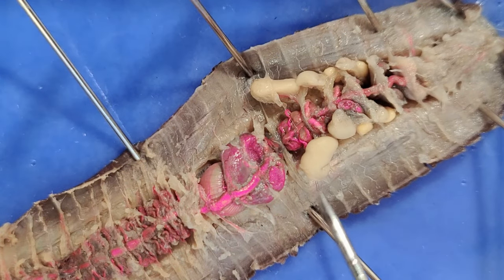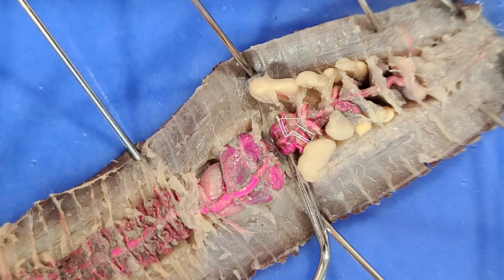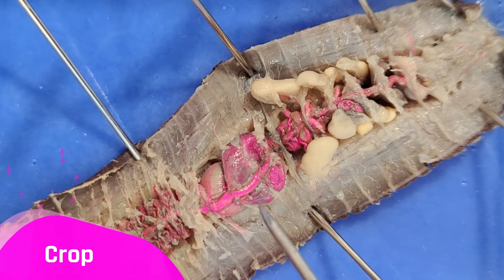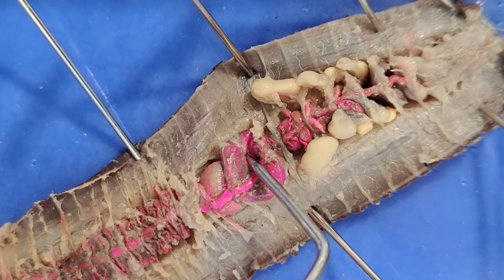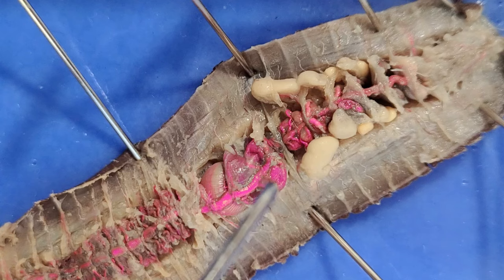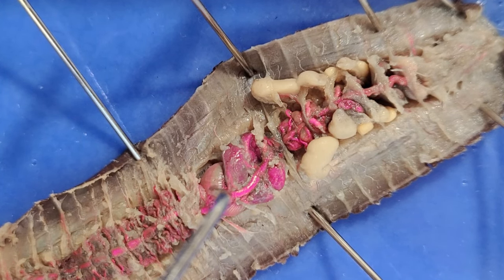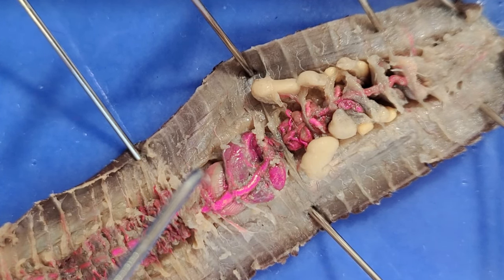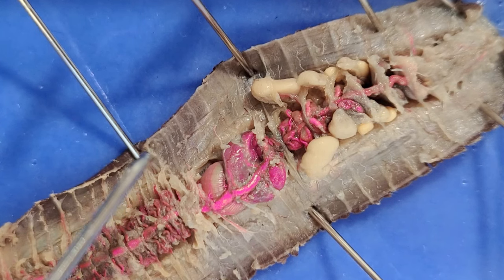What's buried under all these aortic arches is the esophagus. The esophagus connects the pharynx to the crop right here. The crop is a sac-like organ that stores food until it can be moved to the next chamber, which is the gizzard. Notice that the crop is soft and thin — you can squish it really easily. But the gizzard is really hard and barely moves. The gizzard has a thicker muscle lining because it needs those muscles to grind up the food. And because worms don't have any teeth, they swallow little bits of rock or sand to help break down the food in the gizzard.